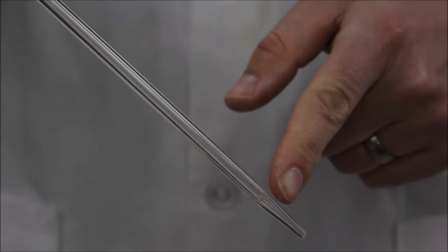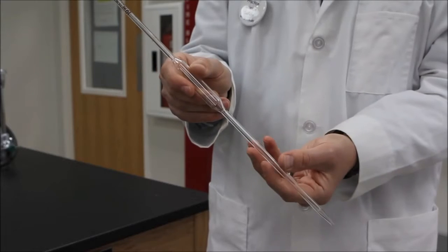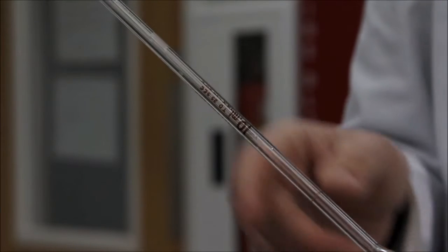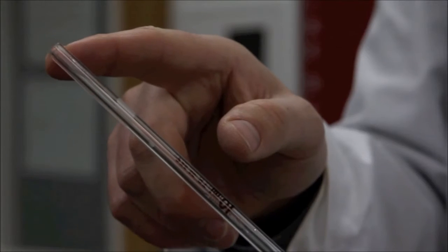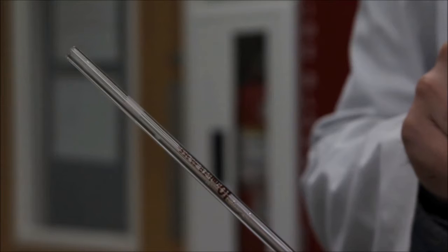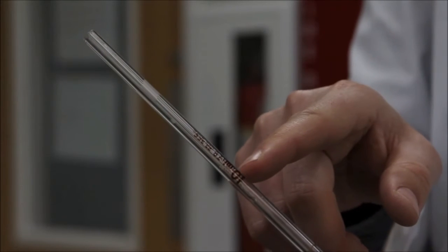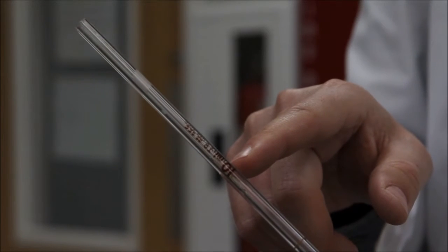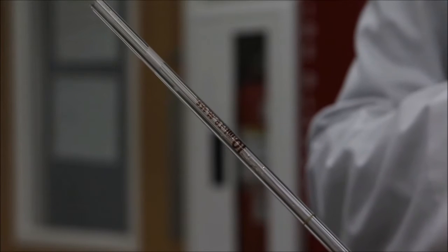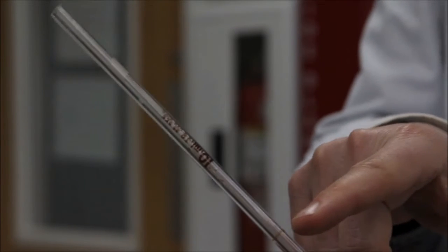We'll start with the parts of the pipette. At the very bottom is the tip, and at the very top is the pipette mouth. Notice that every pipette is labeled with the volume it's calibrated to deliver—10 milliliters for this pipette—but only when filled exactly to its etch mark.